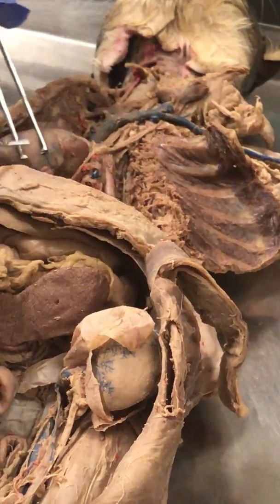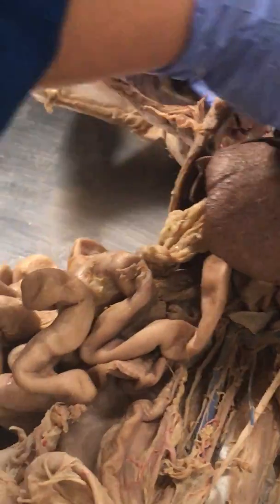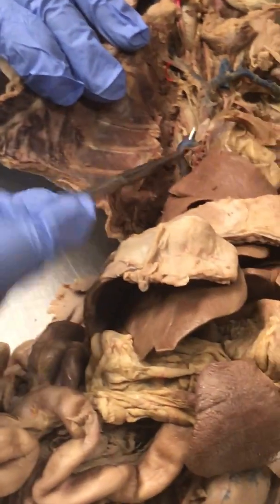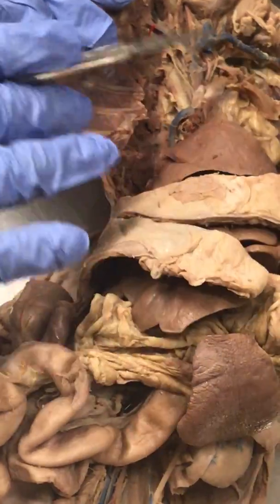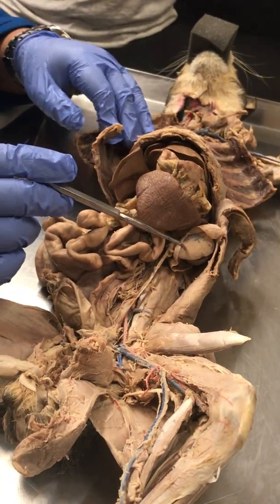All right, now if we go down here, you don't really see much. We got cat lungs, but I want to skip the cat lungs. There is one more vessel. You see that big one on the side right there? That's the azygos, right? And the azygos drains into the what? Superior vena cava. Great. Now, you know that the thoracic cavity is separated from the abdominal cavity via what muscle?